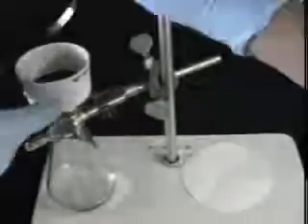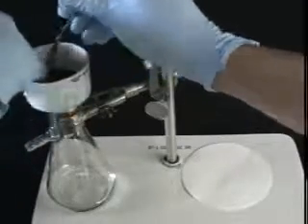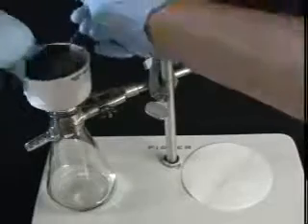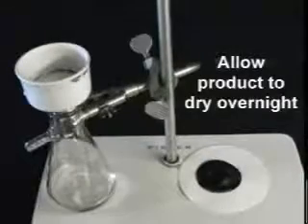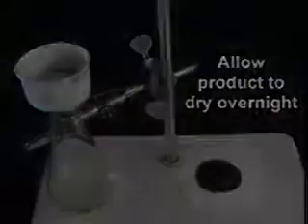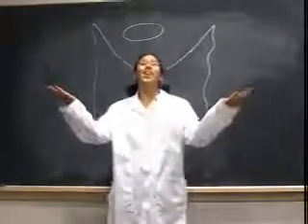So how about collecting the product? If you were aiming for the solid product, use a spatula or some sort of tool to release the filter paper from the funnel. Set it down on another piece of filter paper or a watch glass and allow the product to dry overnight. So now you're finally all filtered. Now that you've got the skills, go out and purify the world.